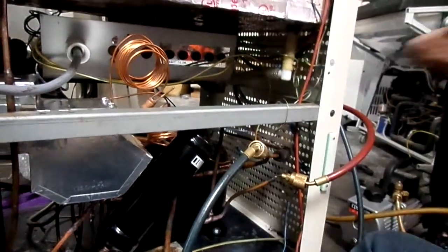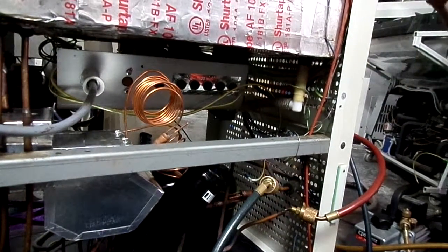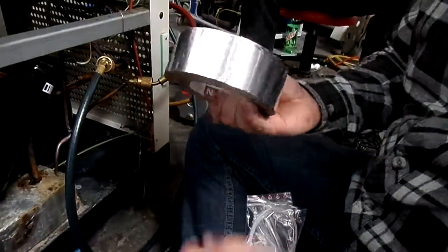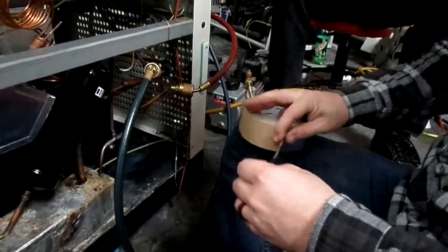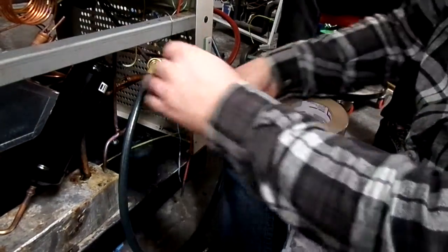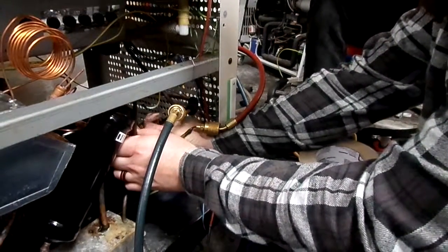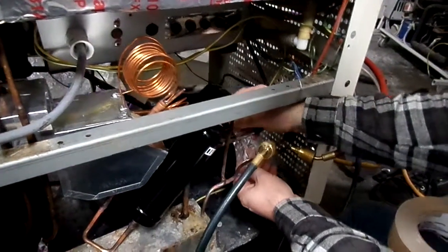So your E-valve kit comes with a small variety of zip ties. And you have to supply your own metal tape. Unfortunately, just take a little strap. And you're just gonna put it on top of your return line. Right there, sir.